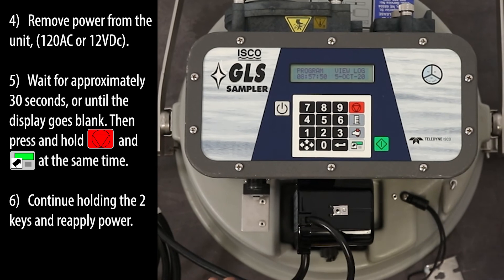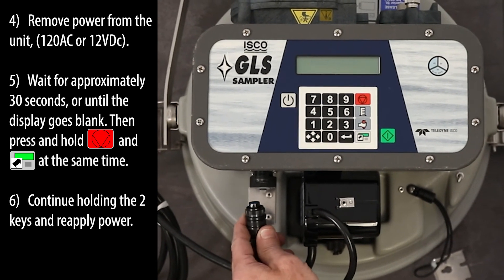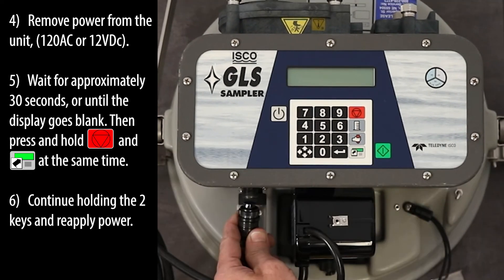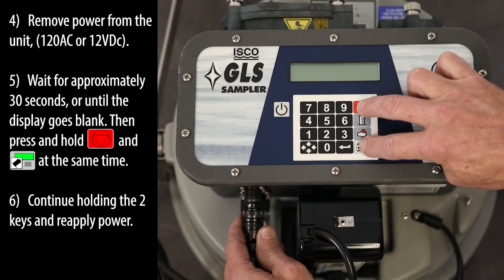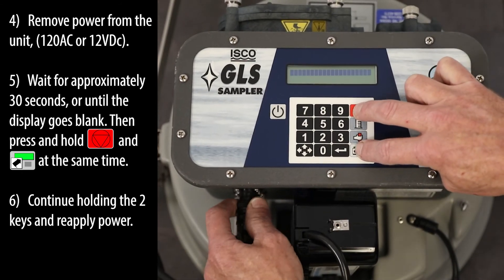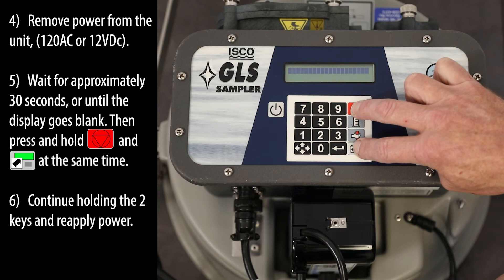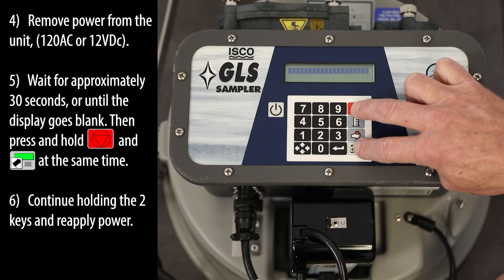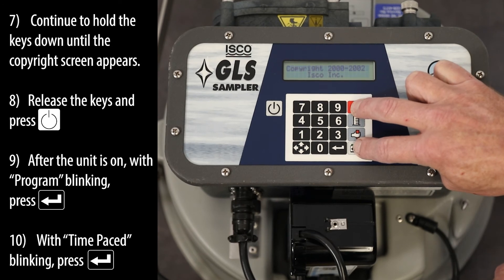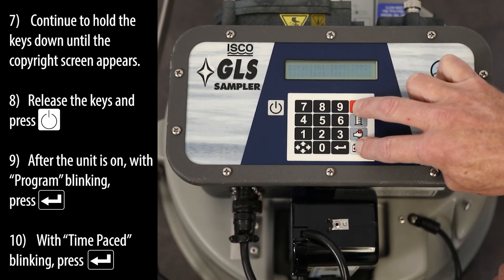Remove power from the unit. Wait for approximately 30 seconds, or until the display goes blank. Then press and hold the red Stop and stored program keys at the same time. Continue holding the two keys and reapply power. Continue to hold the keys down until the copyright screen appears.